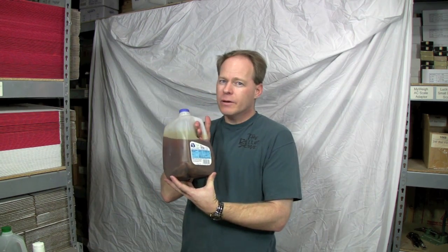Hi, my name is Graydon Blair from Utah Biodiesel Supply and today we're going to show you how to do a titration which is measuring the acidity in the oil. We had a customer bring by some vegetable oil and we don't know what its acid level is and we need to be able to make biodiesel out of this oil and to do that we need to do a titration.